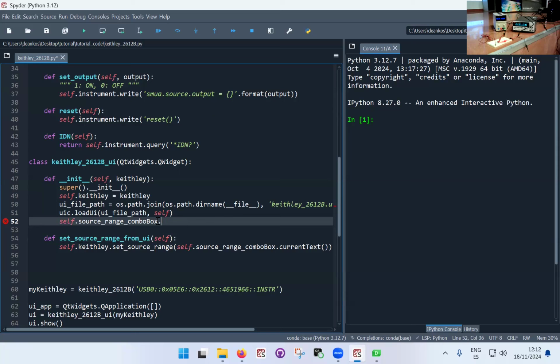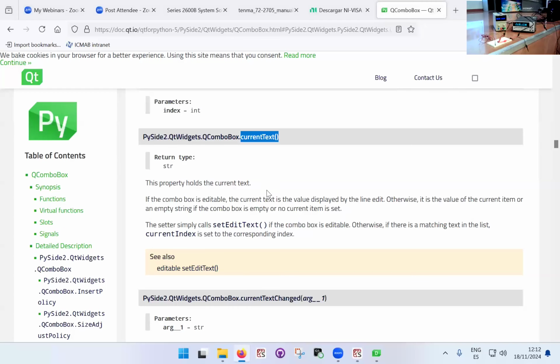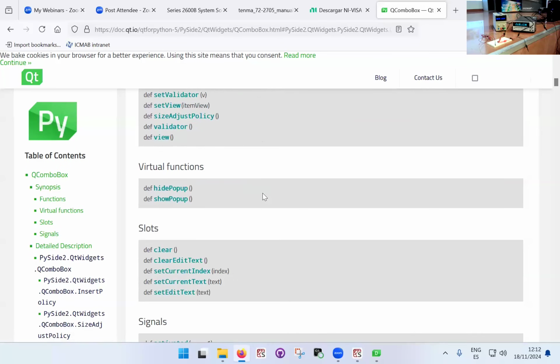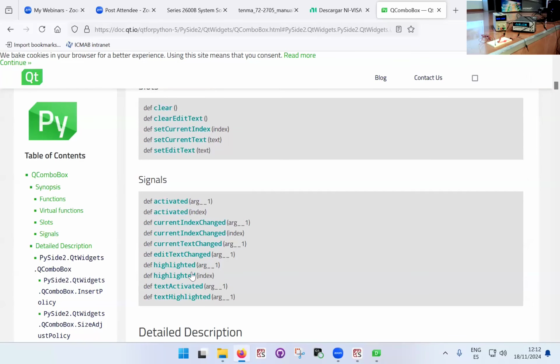In this particular case, the combo box has a certain number of functions, which we can have a look at again here, and this will be in the signals. Within the signals you have all the possible events which are pre-programmed within the Qt library that can happen and which can trigger the execution of a function. In this particular case, what I'm interested in is probably either current index changed or better, current text changed. So if I go in the combo box and I select something, that selection, the fact that I clicked it, will trigger this clicked event.